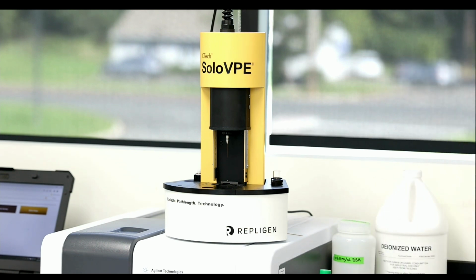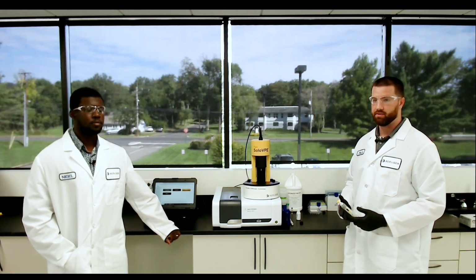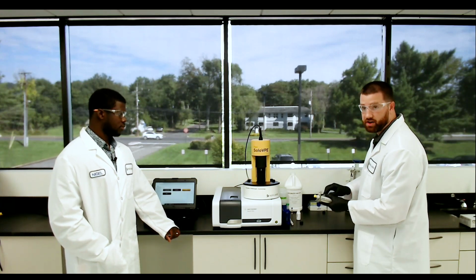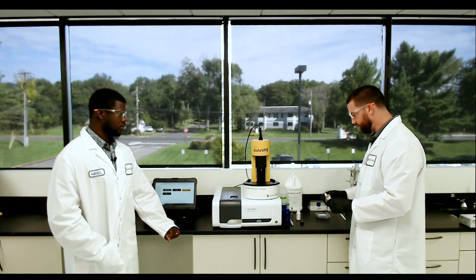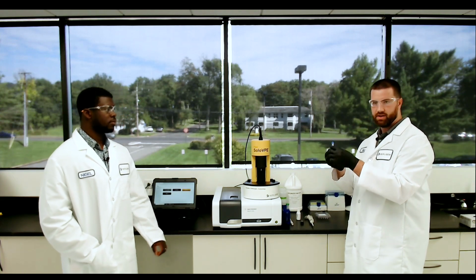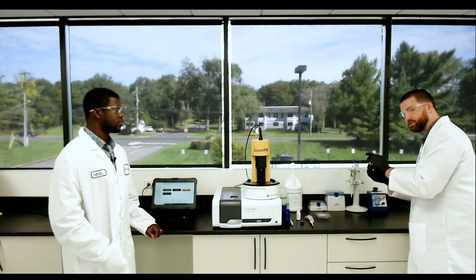So for this, we're going to need 120 microliters maximum for the 5 millimeter path length limit plastic vessel. The minimum volume you can use in here is 20 microliters just to cover the bottom. We're going to use 100 right now. So this is our plasmid, and we're going to vortex it first, so it's very important to mix. I like to do a little inversion just to make sure there's nothing in the cap.